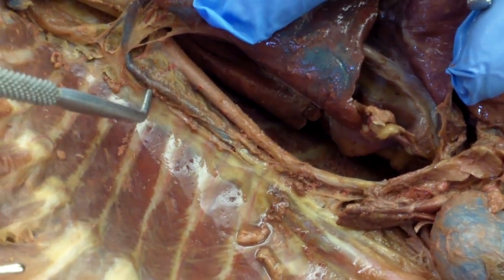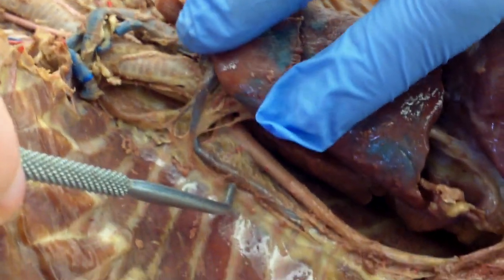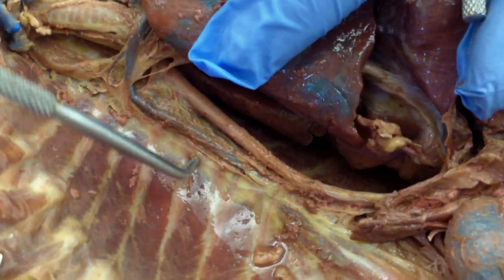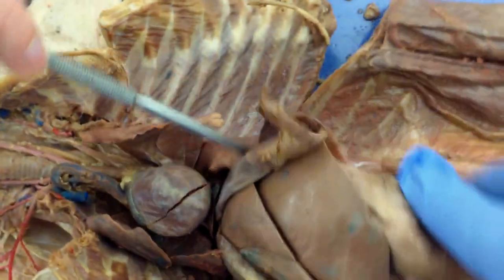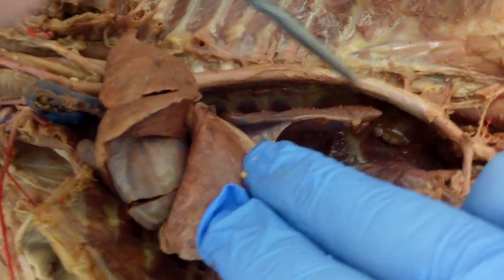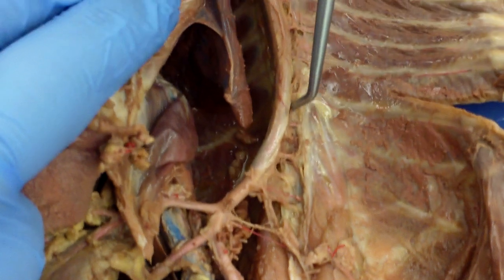And here is the vein called — the azygous vein. And then on the other side. Now we're gonna flip — so to get your perspective: here is the descending aorta again, and your intercostal arteries.